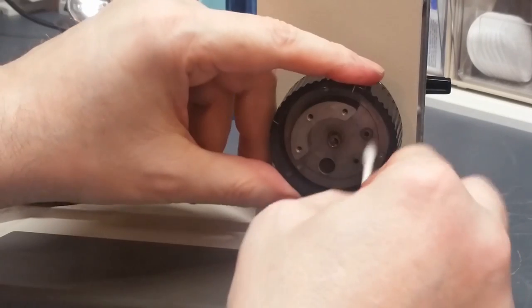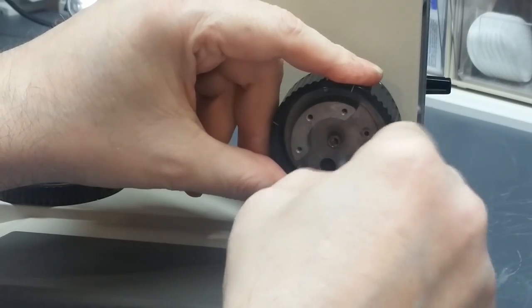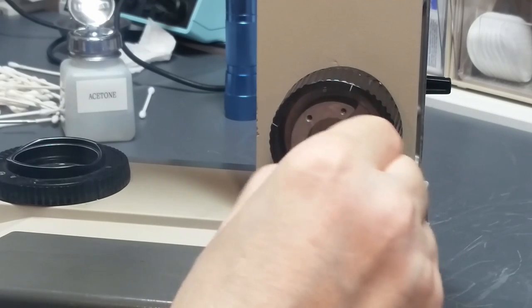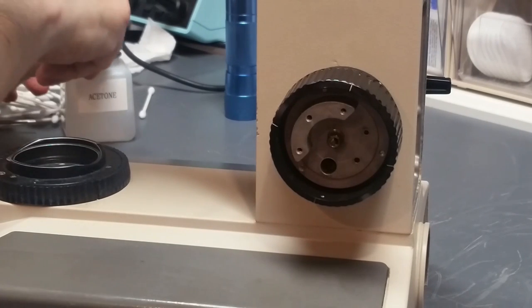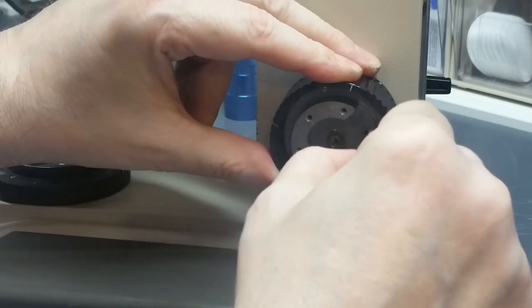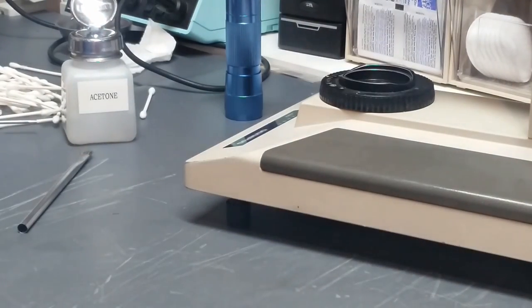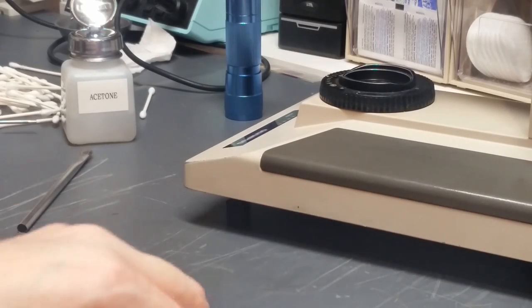Cotton swabs, acetone. Clean the grease off of these. While I'm at it, clean the grease out of that hole. Okay. Now I take the pipe cleaner, a little alcohol on that. Run it in these holes here just to make sure that there's no old grease in there mucking it up. Okay, let's slide this back out of the way. And I'm going to clean all these.